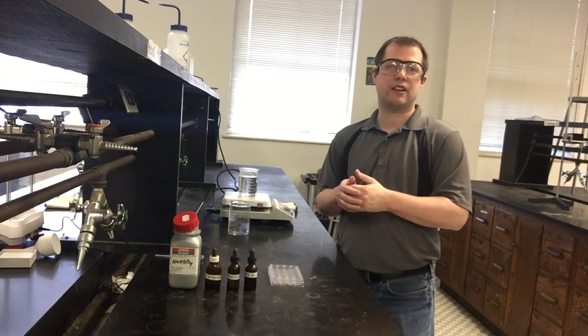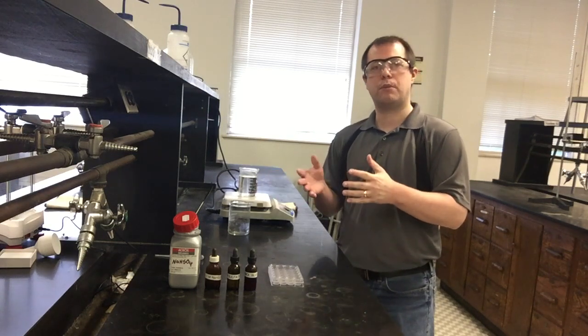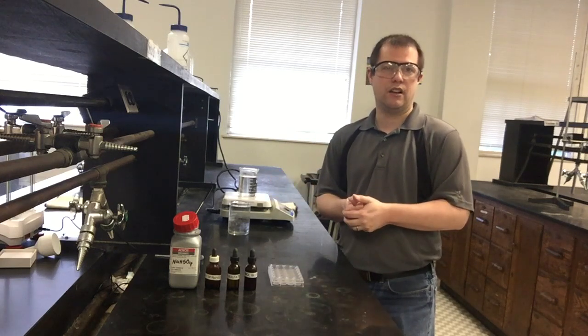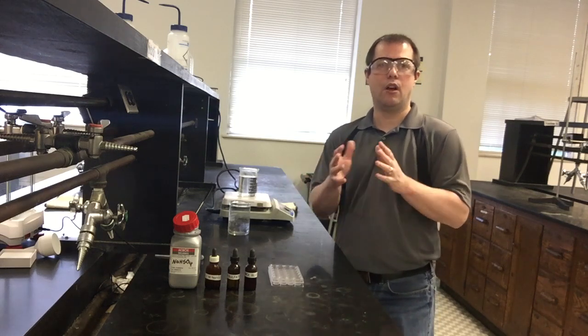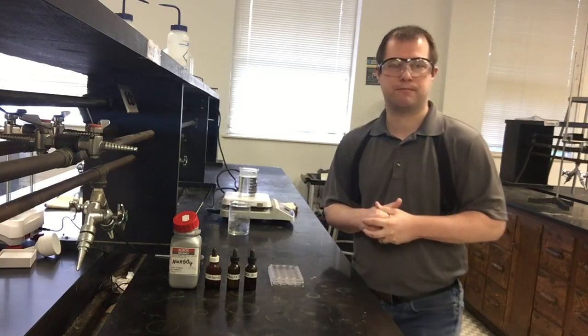For each of these different reactions, we're going to have colors associated with the reactant and product sides of the reaction. Then we're going to make some change to that equilibrium and observe what color change happens. That color change should help indicate, oh, if the color changed to the side that indicates products, that means we just made a bunch of products from whatever we just did to our reaction. And it gives us information about what's happening. It'll make a little more sense as we look at some of our first examples, but that's what we're going to be looking at throughout this entire experiment: the colors as we make all of our changes.